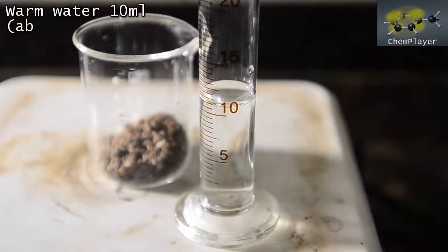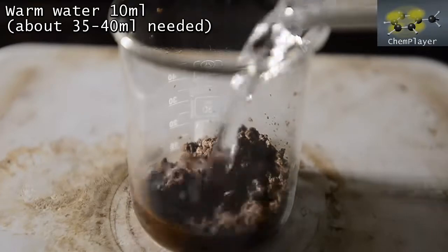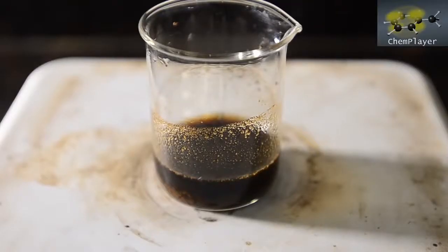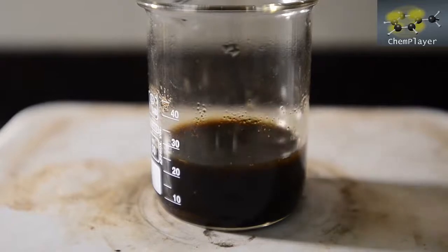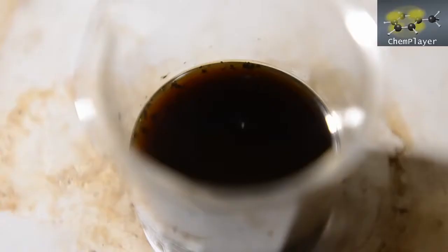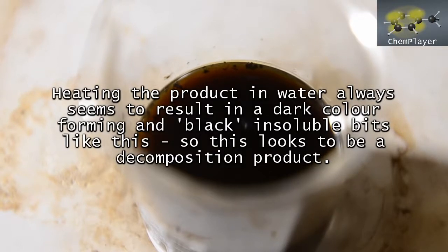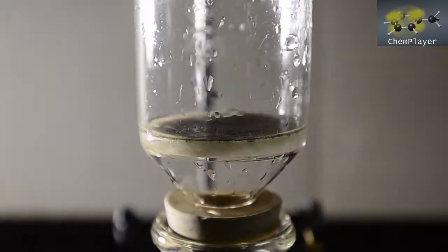We'll get a little warm water in here to start with, about 10 mils, and then see how we go. Added a little more water and now warming gently. Okay, we've got everything in solution using about 40 mils volume in total. But as you can see, there are some dark black colored insoluble impurities floating around. So let's filter the hot mixture and remove these first.